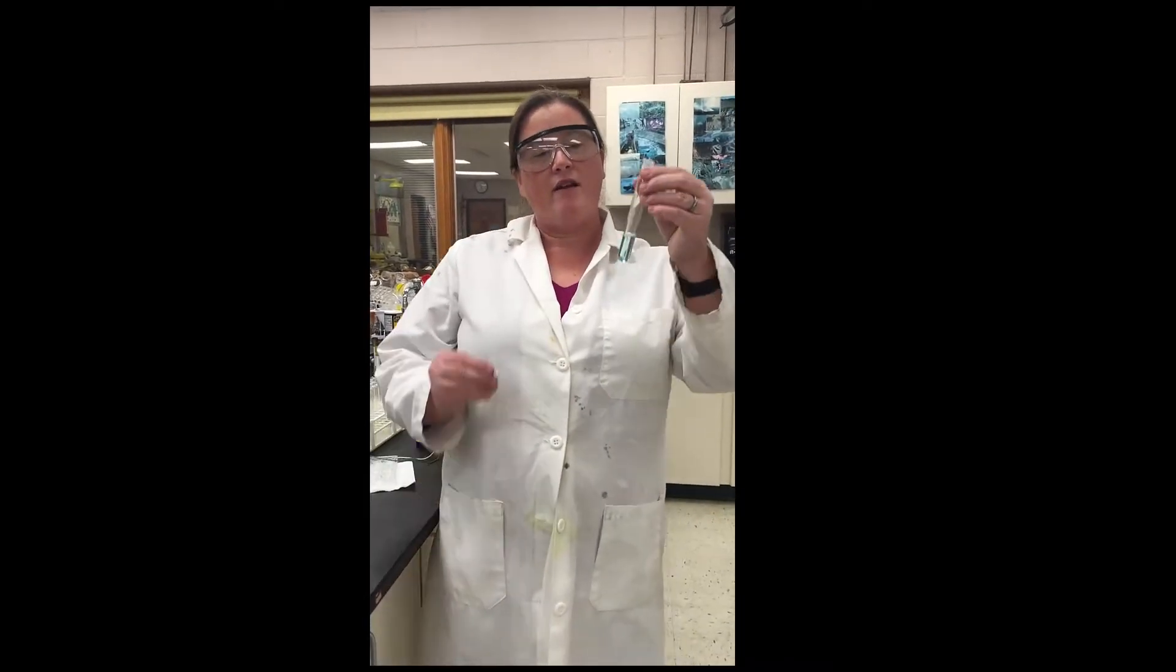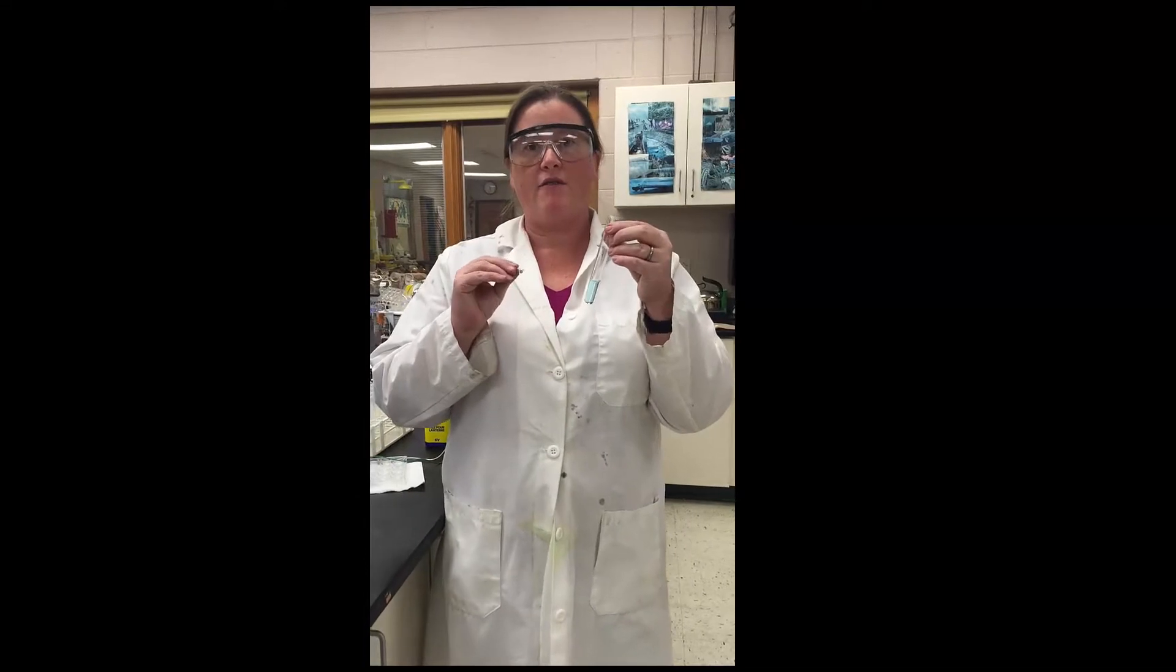In this video, I'm going to be showing you Reaction 3 of the Copper Cycle Lab. And in Reaction 3, it's a single replacement reaction.